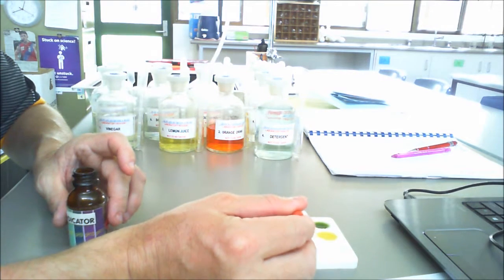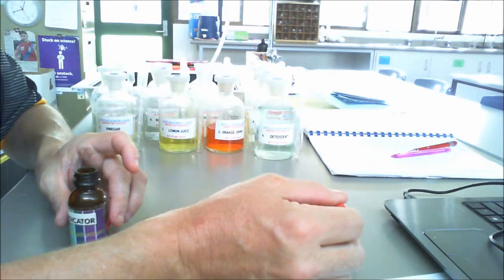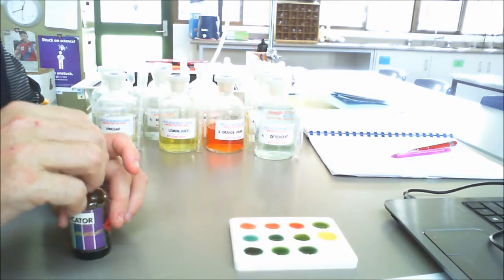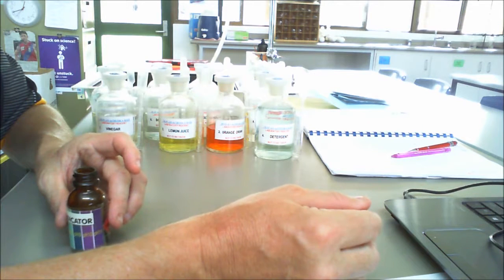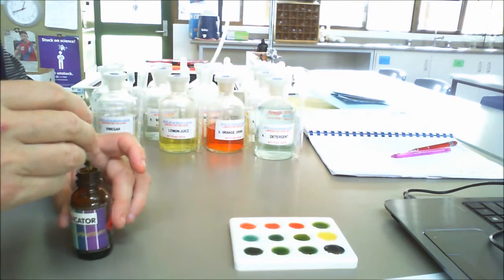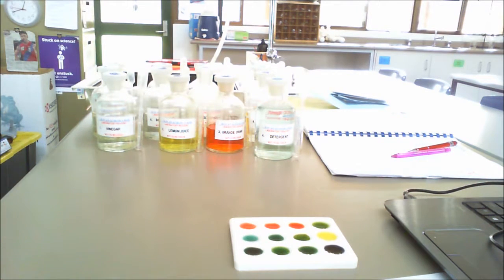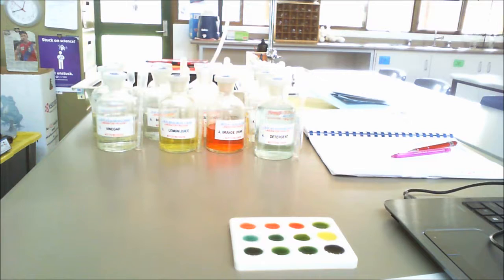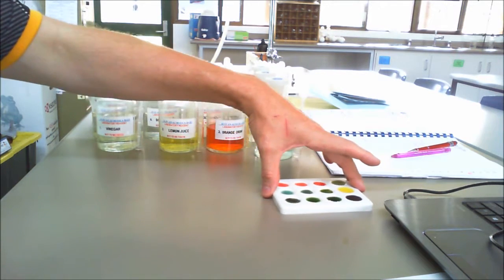For our salt solution, that's basically a green there. For our swimming pool water, it's kind of a dark green bluish color. And then finally for the washing powder, it goes a really dark blue. So what you might want to do now is record in your table the various colors, remembering about this one in particular down here, which is basically the bleach, because that went blue first, and then you can record the colors and determine if it's an acid, a base, or a neutral solution.